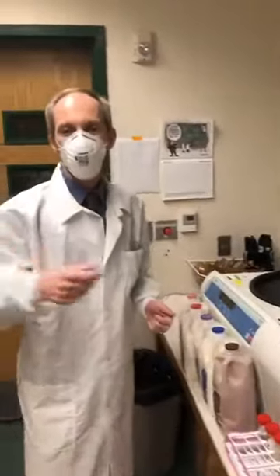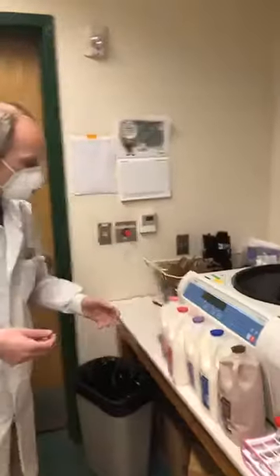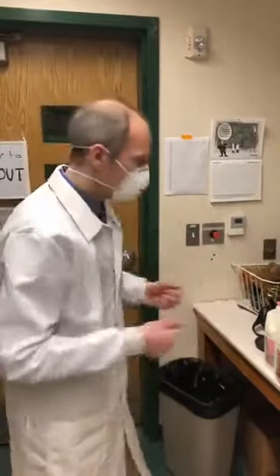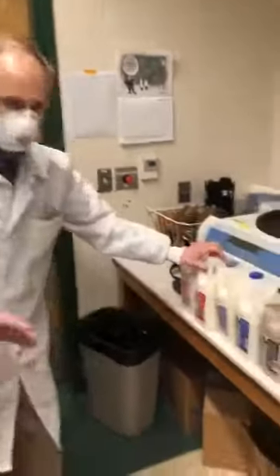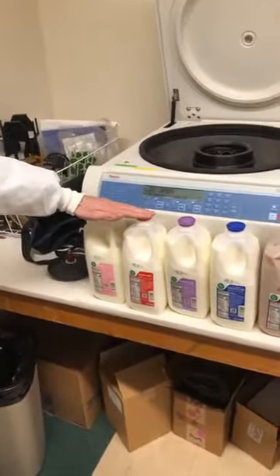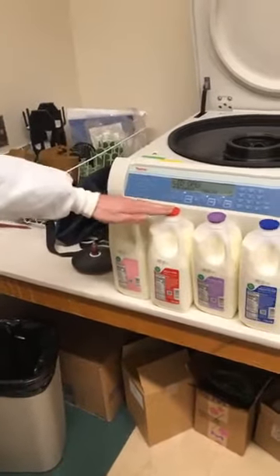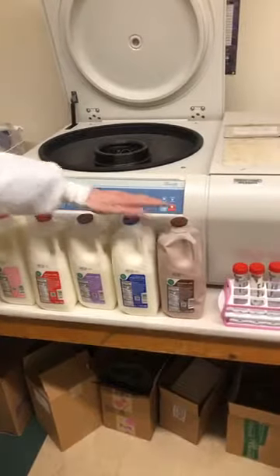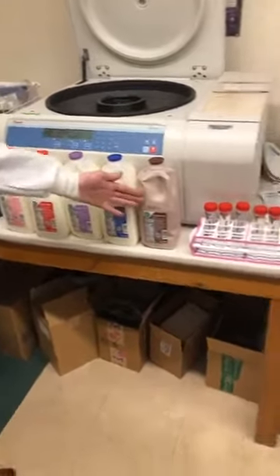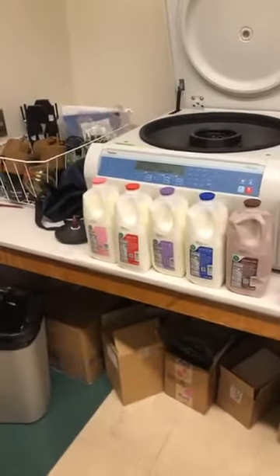The first experiment I want to tell you about is thinking about what is the composition of some of the drinks we encounter in everyday life. I went to the grocery store yesterday and bought a variety of different kinds of milk: fat-free milk, whole milk, low fat, reduced fat, chocolate milk. Have you ever wondered what's the difference between them? They have different names but they all kind of look the same — except for the chocolate milk. What I want to find out with an experiment today is what in fact is the difference between them.